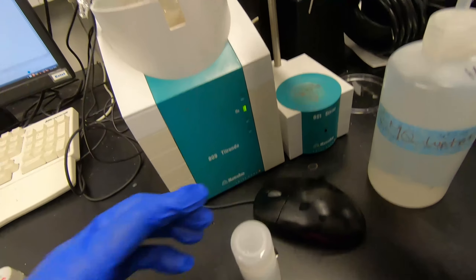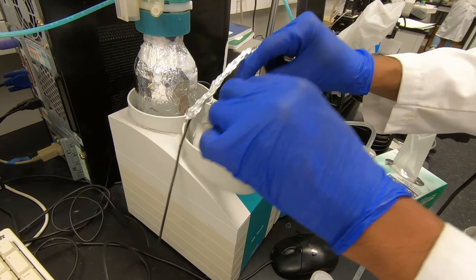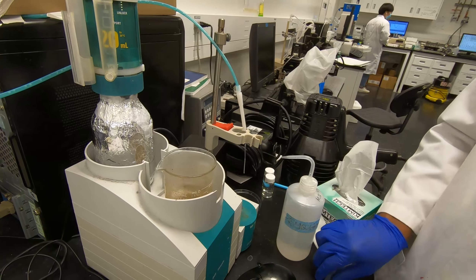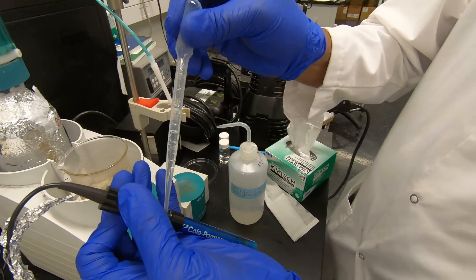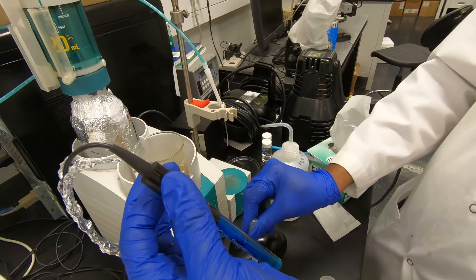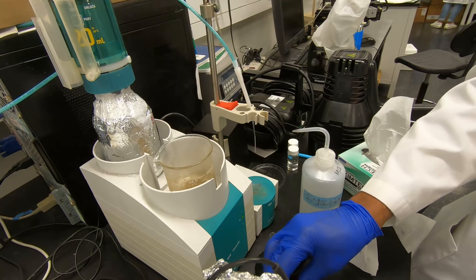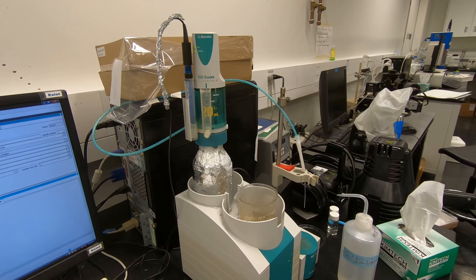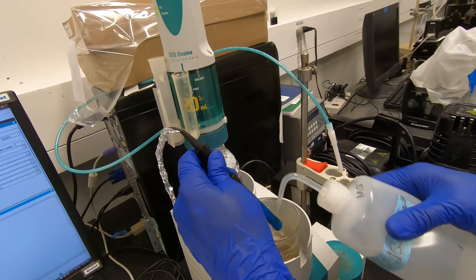Just replace with the standard solution - this is all we have. We can prepare more; it's just 10 percent. We don't need to wash it if you want to save time. How much do I need to fill each time? Half. So just wash it with water.